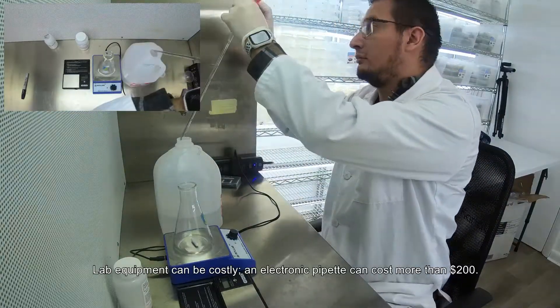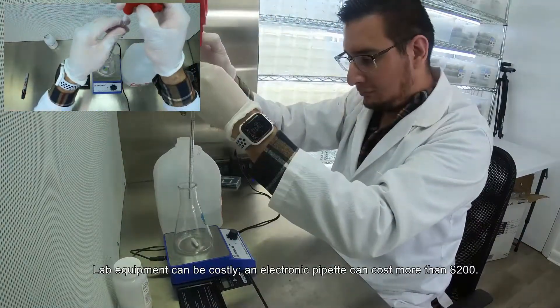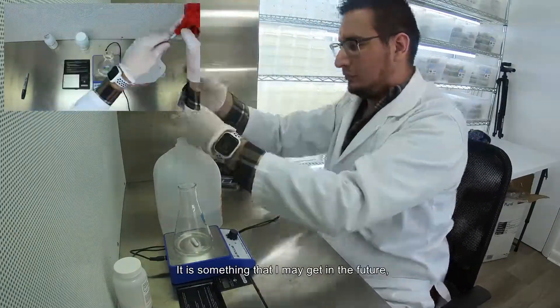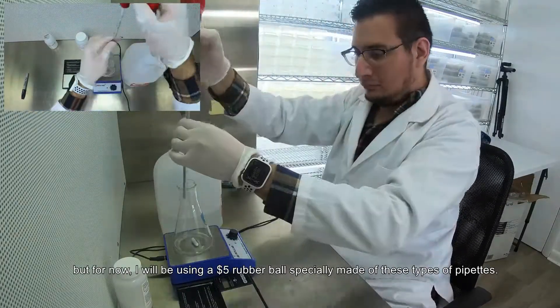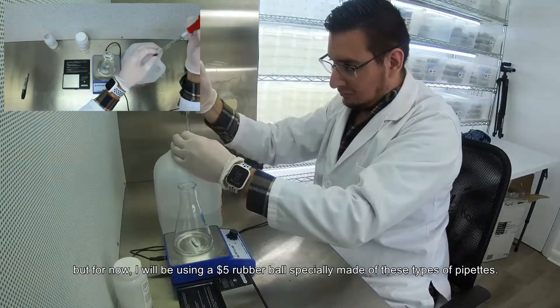Lab equipment can be costly. An electronic pipette can cost more than $200. It is something that I may get in the future, but for now I will be using a $5 rubber bulb especially made for this type of pipette.